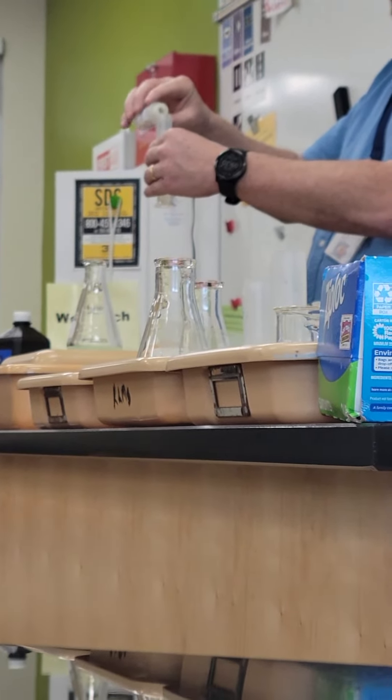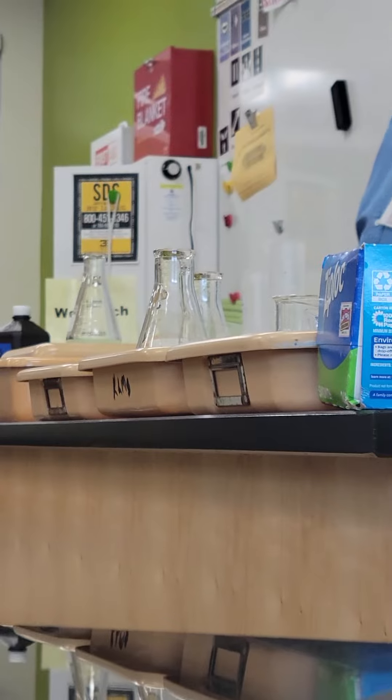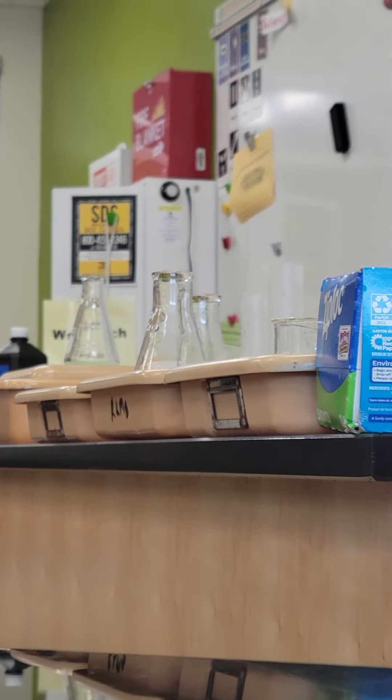You know, I see a lot of you guys measuring like this, and that's a good starting point. You always want to set it down like that.